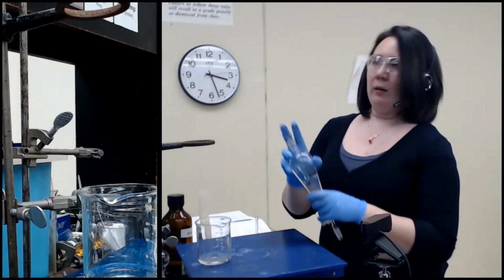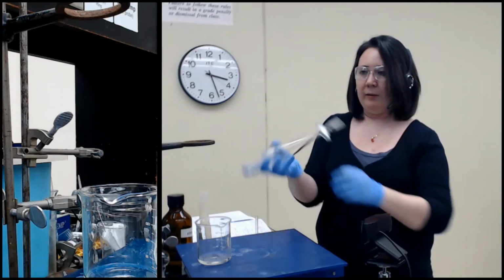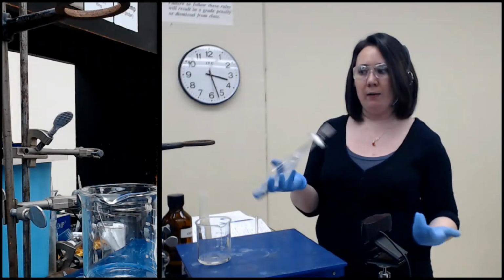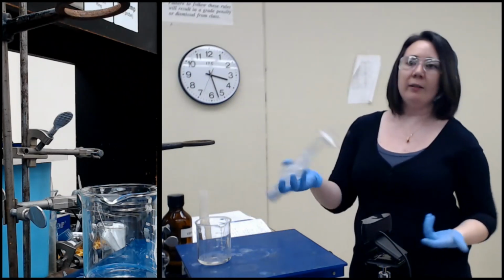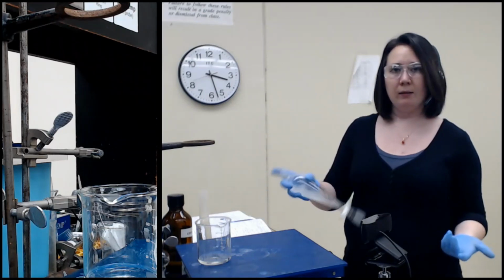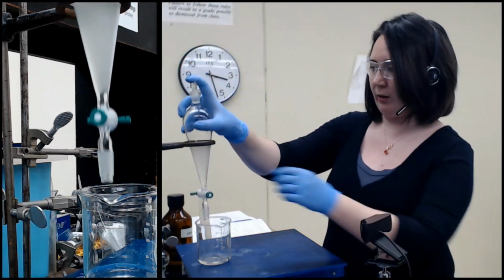So there are a few different ways people might decide if you're done. Some people just say do this for like a minute or two. I think that can be too long and you risk forming an emulsion, which means you just have to sit there forever and wait for it to loosen, disperse, I guess. The other way you can tell is when you go to vent it, if you don't actually hear any gas release anymore, or there's no change in the mixing anymore, that's another hint. So, seems done. No more exchange going on.